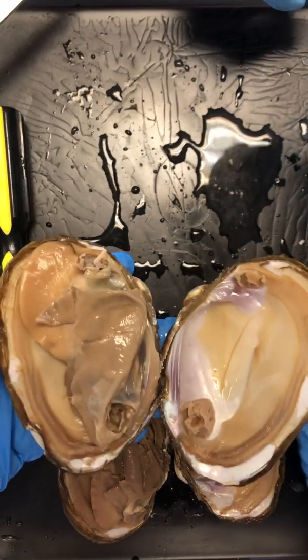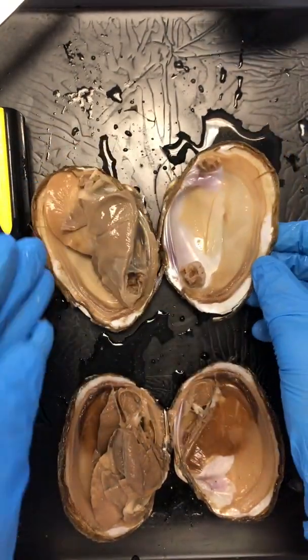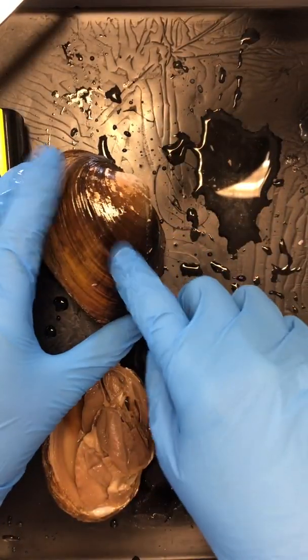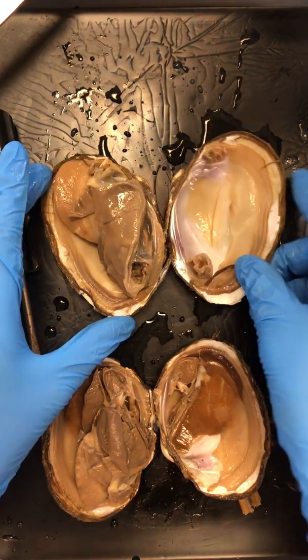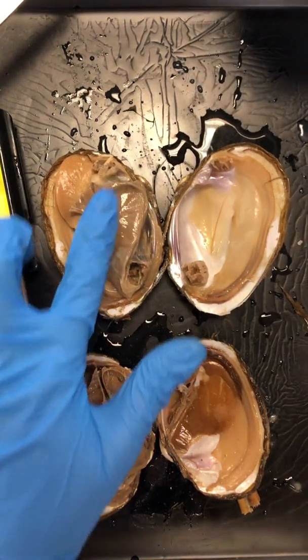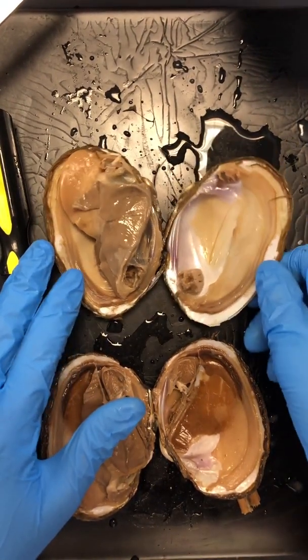Nice. So we want to be able to find those four characteristics of mollusks in our cool mussel here. First things first, we're going to look at the shell. We can see it on the outside. It's got these lines of growth. It's nice and hard. What's the function of the shell? Any guesses, Coach S? Why would something want a shell? For protection. Protection! Nice! Look at all these squishy soft insides, right? It needs something to keep them nice and safe. So that shell is mostly there for protection.